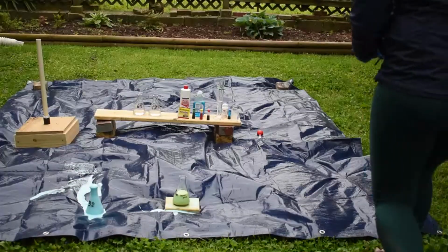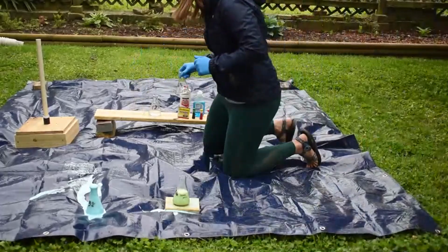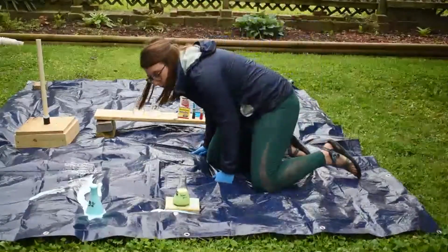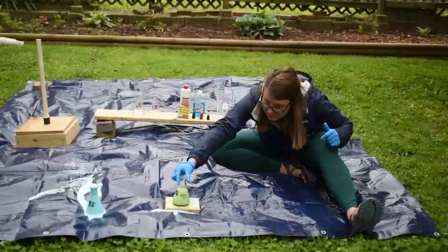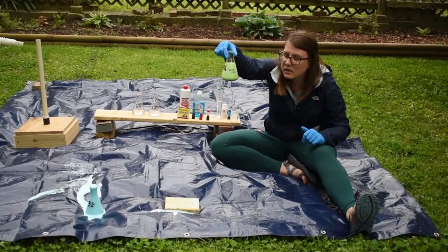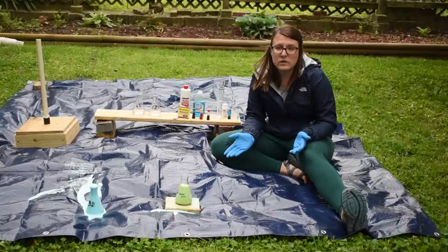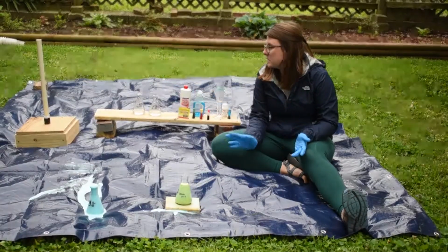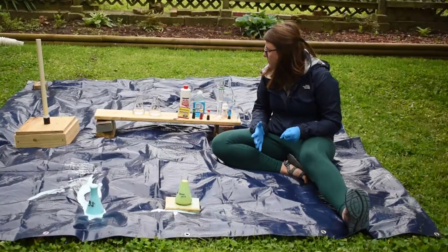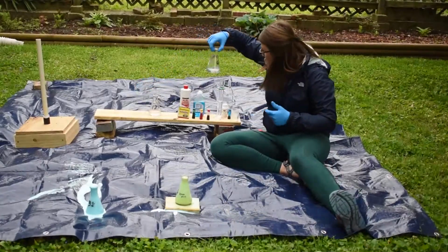Okay. So we have a 6% solution. What I bought was concentrated hydrogen peroxide, and that is 12%. You can see we got it almost going up like that. It's almost out of the Erlenmeyer flask. So I diluted the 12% by 50%. I used half of the chemical solution and then half water. And so that's what we have with our 6% solution here.